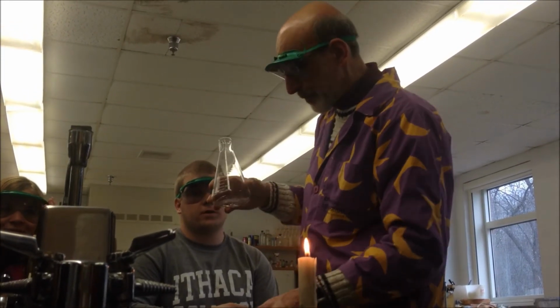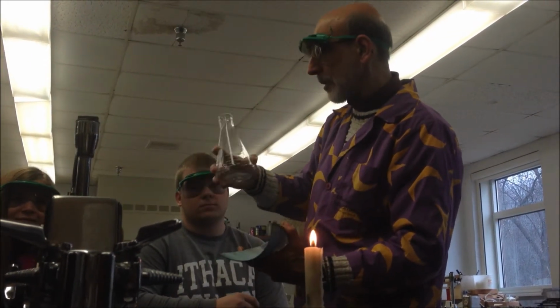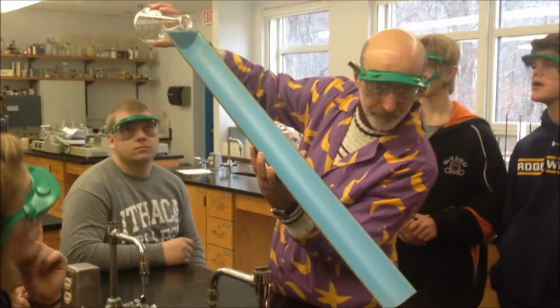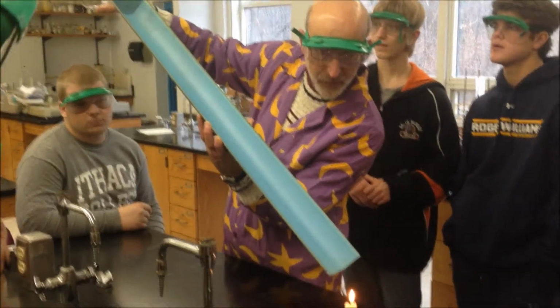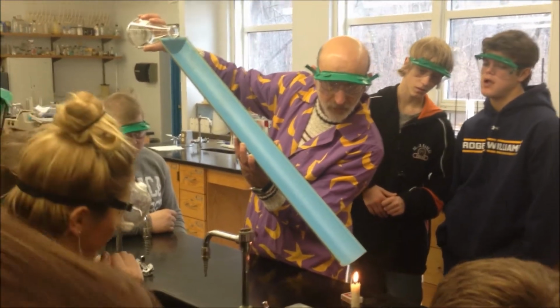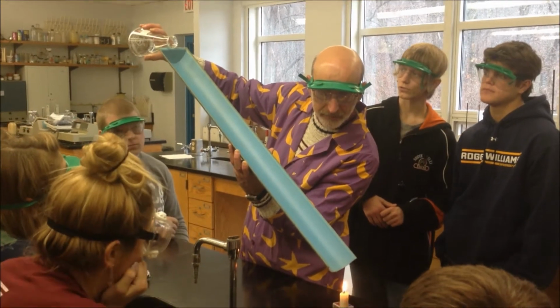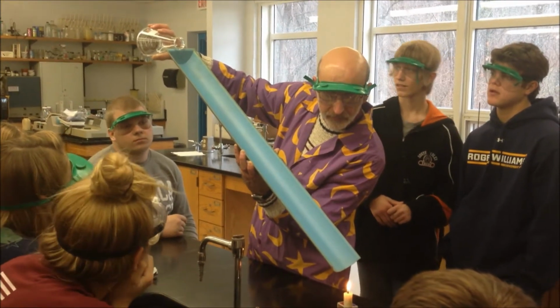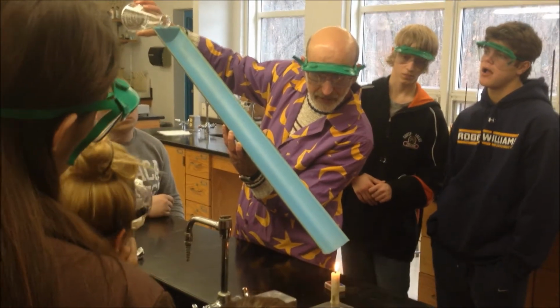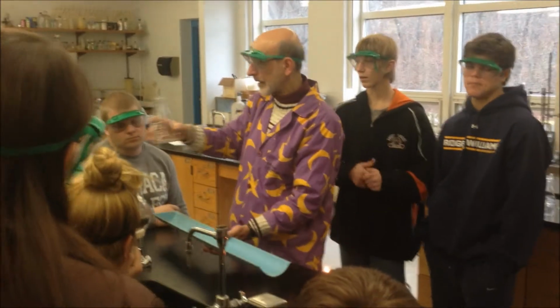And because it's carbon and hydrogen, it's very flammable. So all I need to do is vaporize this, which happens very easily. And when the vapors get to the bottom and hit the flame, I just don't want to pour any liquid because that gets a little messier. Am I near the liquid? No. Not even close. Yeah, sometimes the vapor, oh, there we go. That was a little slow, but you got the idea, right?